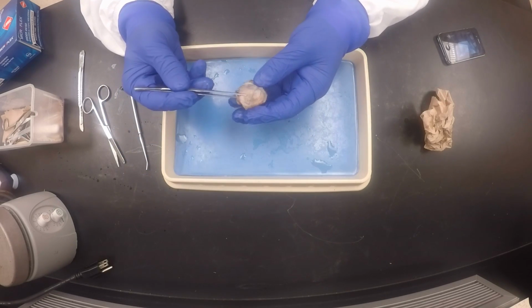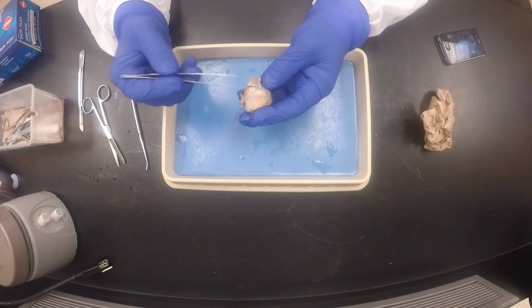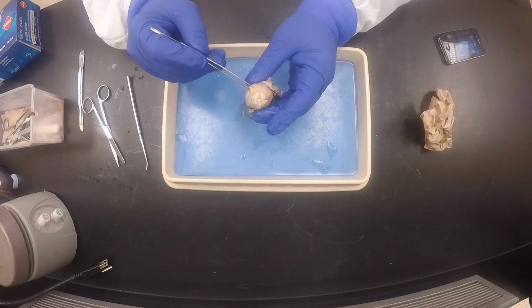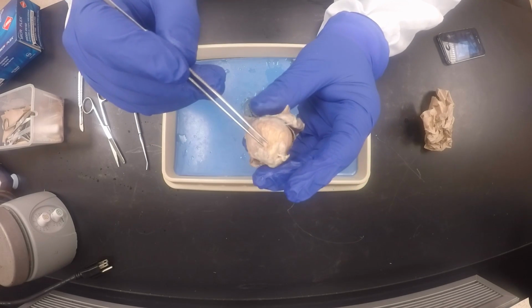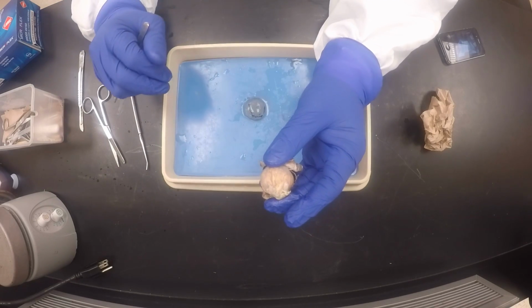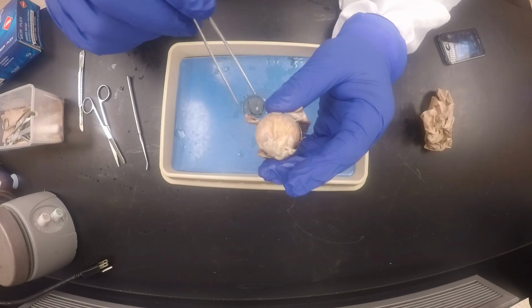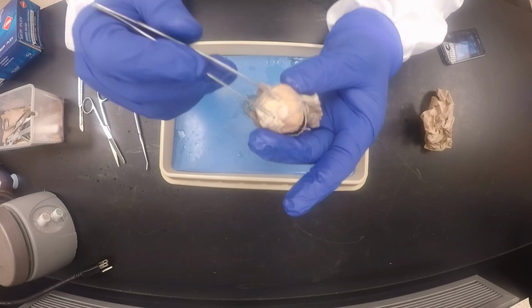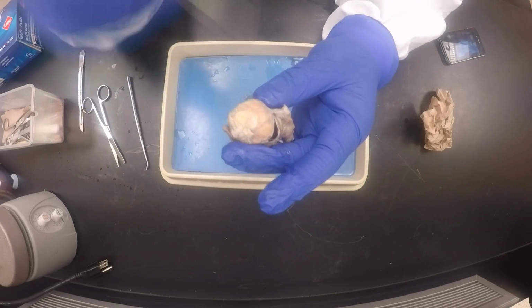Like I said, only in ruminants like cows, sheep, goats, and so on, they have this 7th muscle, which is the retractor bulbi. This one right here. Humans do not have it. The retractor bulbi literally retracts the eyeball inwards so that the eye doesn't get hurt when the cows and goats are grazing and there are twigs in the way. It will retract the eyeball inwards to prevent damage. You can see here the optic nerve, cranial nerve number 2, that carries sensory for vision.